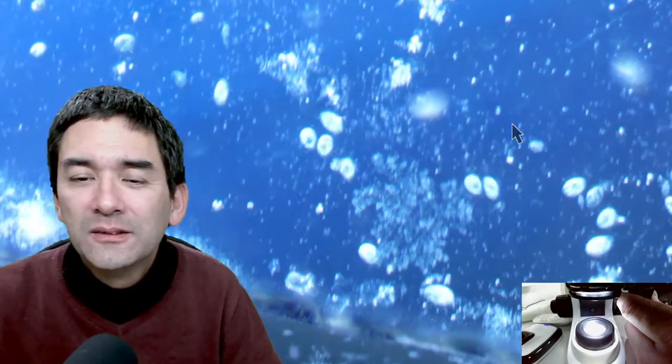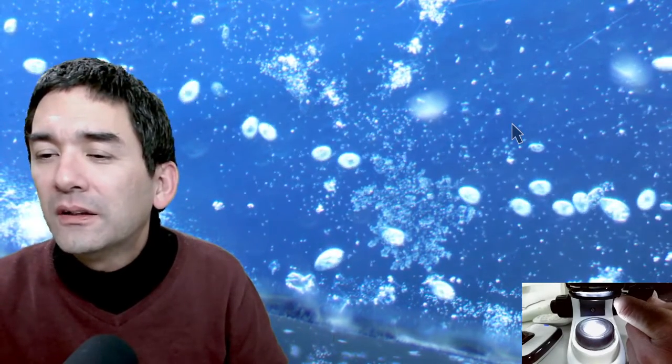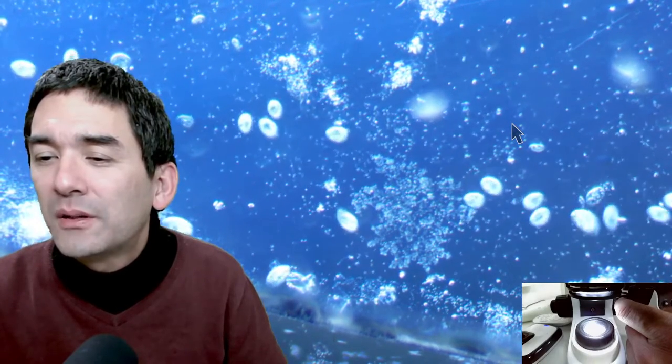With oblique illumination you can also see amoeba a lot easier. A viewer got sick with COVID last Sunday, coughed up some mucus and put it under the microscope — really interesting to see how many white blood cells there are. When you cough, you also rip along a lot of the epithelial cells from your bronchi, so you see a lot of body cells there as well. I also tried this — it was quite a surprise to see a lot of the epithelial cells of the lungs.